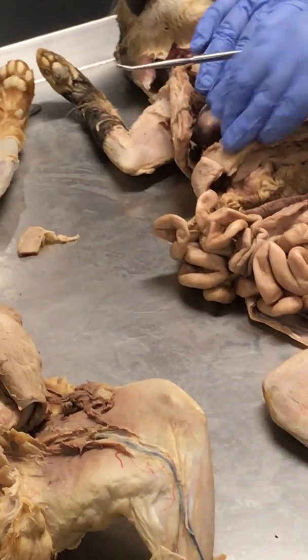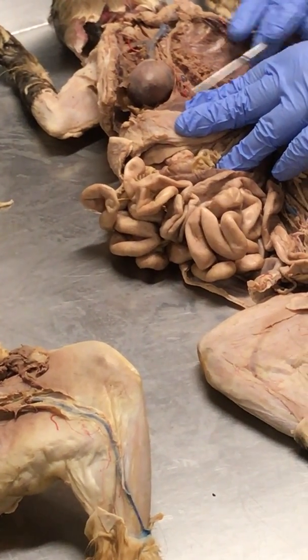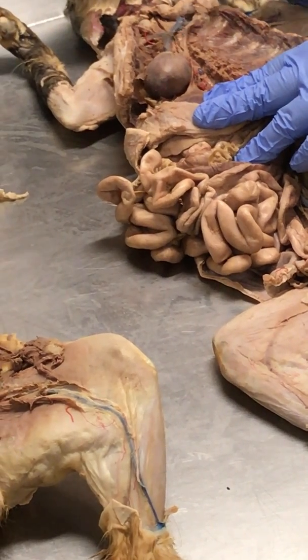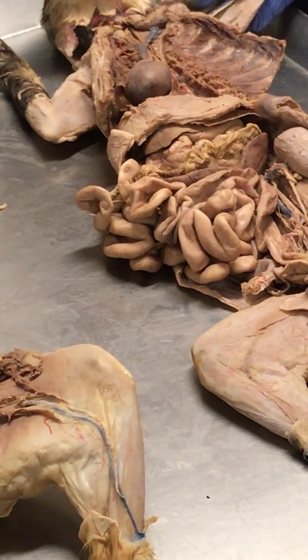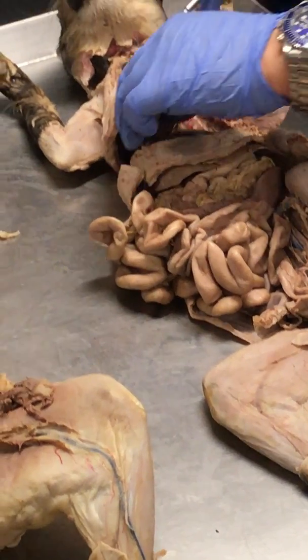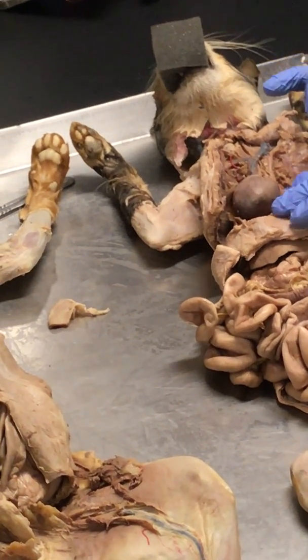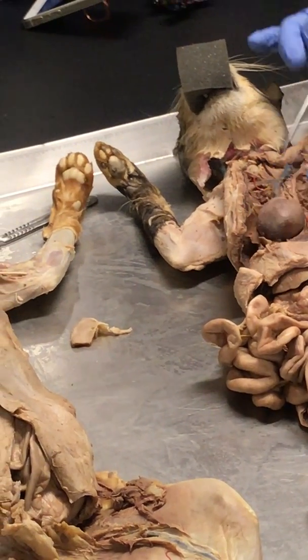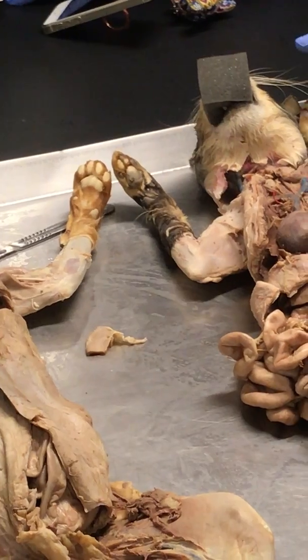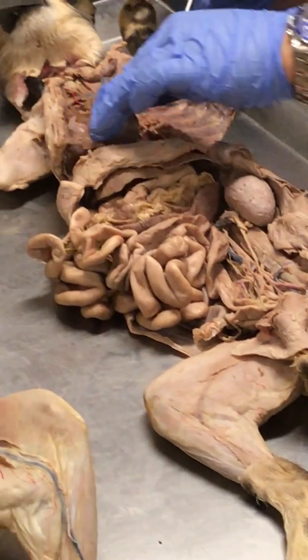Now don't forget that there is a nerve running down the side of the heart on this side. What nerve is this here? Phrenic nerve. Can you two see it? Yeah. Okay. So remember, this is the phrenic nerve. Moving this way, I won't talk about these vessels because that's not on the practical.